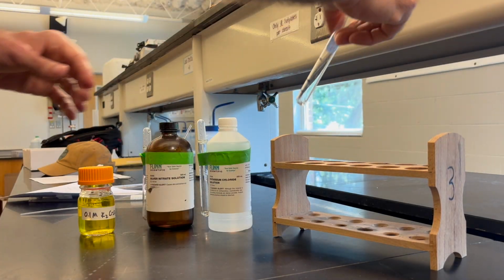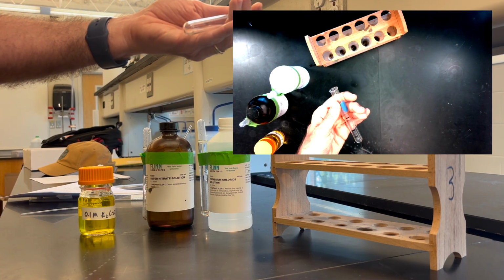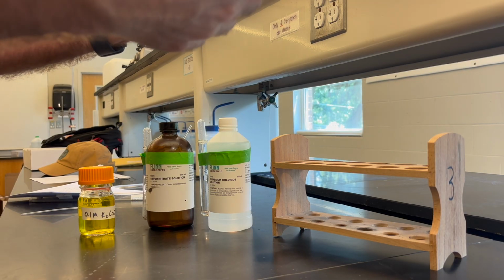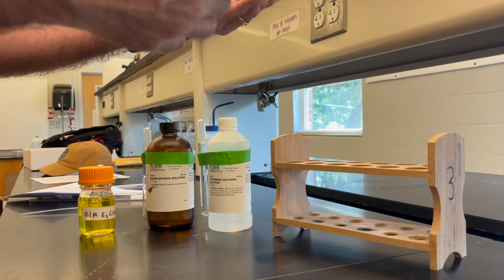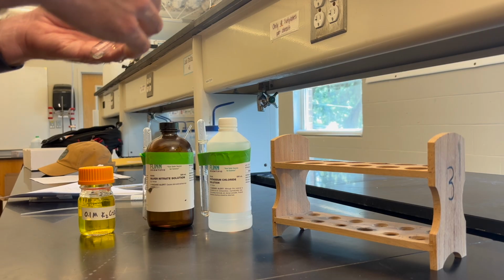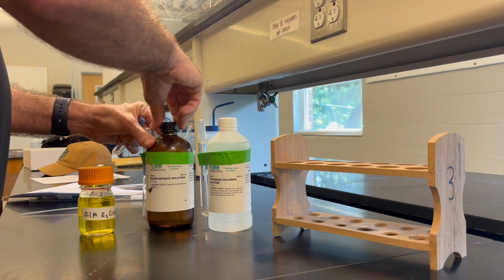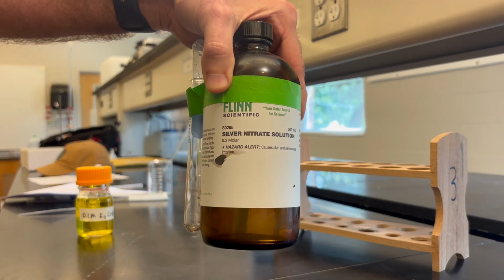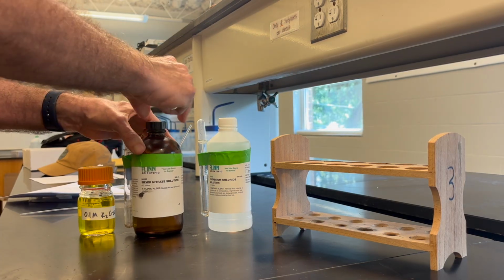First thing I'm going to do in the progressive precipitation lab is I'm going to mark two test tubes, 2 milliliters, 4 milliliters, and 10 milliliters. Technically, the instructions do say to have two test tubes, but for the purpose of this demonstration, I'm just going to do one. The purpose of the first test tube is just for comparison to what happens in part two of this lab. So in part one, we're going to have 2 milliliters of 0.2 molar silver nitrate, and we're going to add 2 milliliters into this test tube.